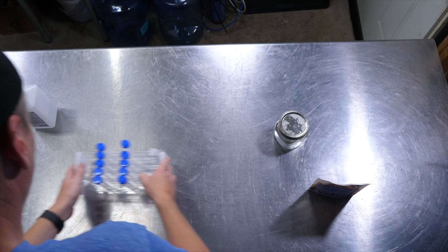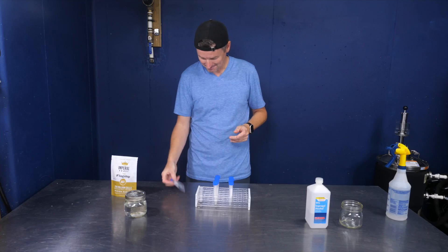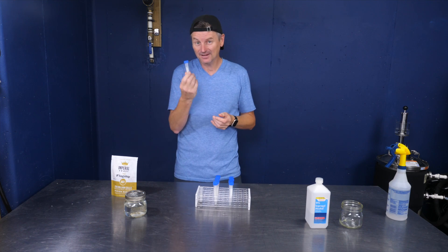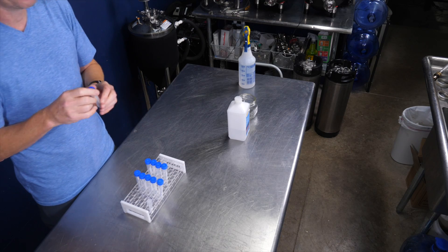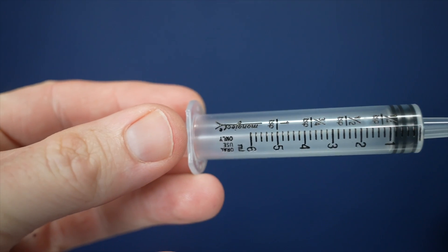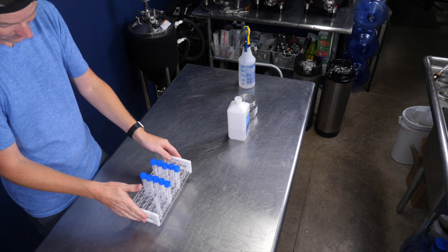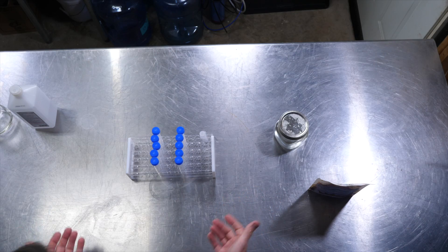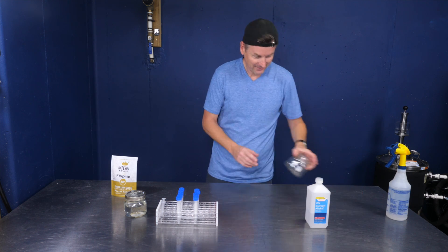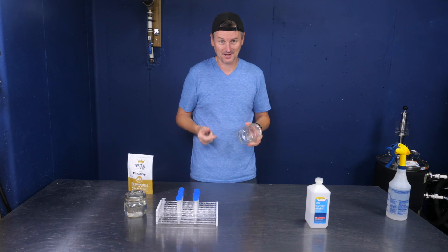You're also going to need some test tubes — these are 15-milliliter plastic test tubes. This is where I'm going to be freezing everything. I'm going to make 10 vials worth, so I've got 10 of these — bought them in a pack of 50 off Amazon. Then I've got a syringe as well — this is a six-milliliter capacity syringe, which is perfect. I also have a test tube holder, which is a nice-to-have. And another wide-mouth pint mason jar to put the yeast into.